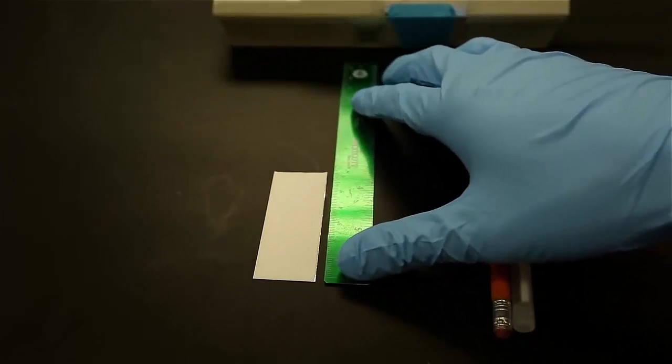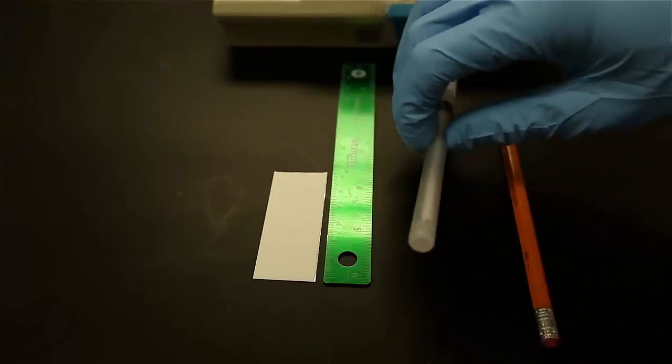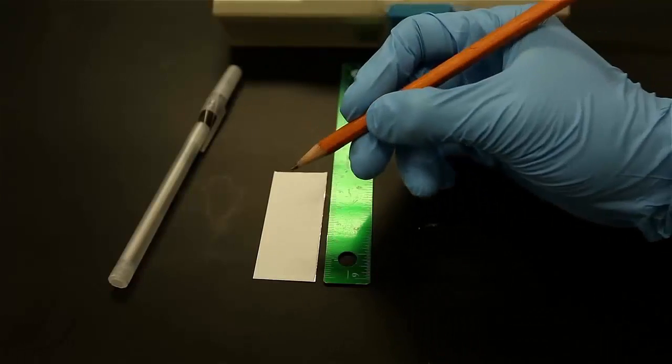Start off by making a dotted line approximately 1.5 cm from the bottom of the plate. This is the origin.